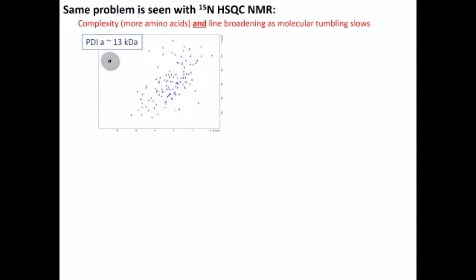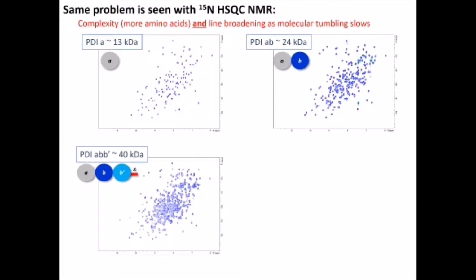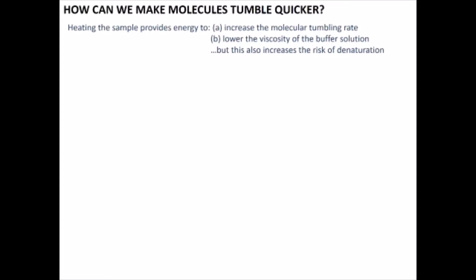The same problem can be found in 2D NMR. So for example, this is the nitrogen 15 HSQC NMR, and you've got the A domain. Can you see the peaks? The signals are broader when you add the B domain, even broader when you add the B prime, and for the full protein, as you can see, the signals are very broad and cannot be interpreted. So what can we do about it?